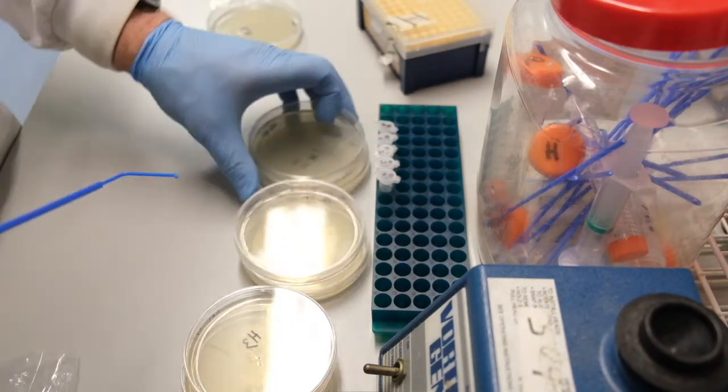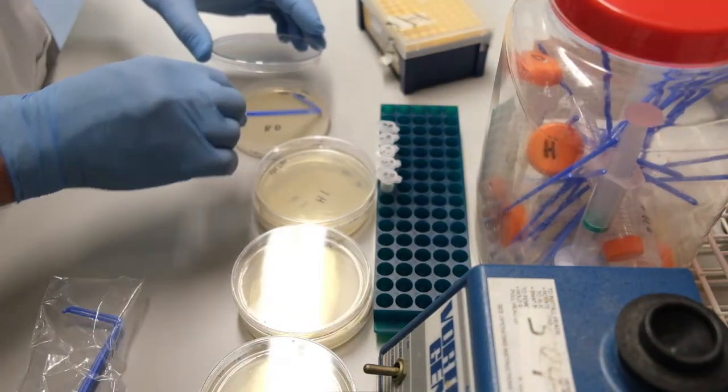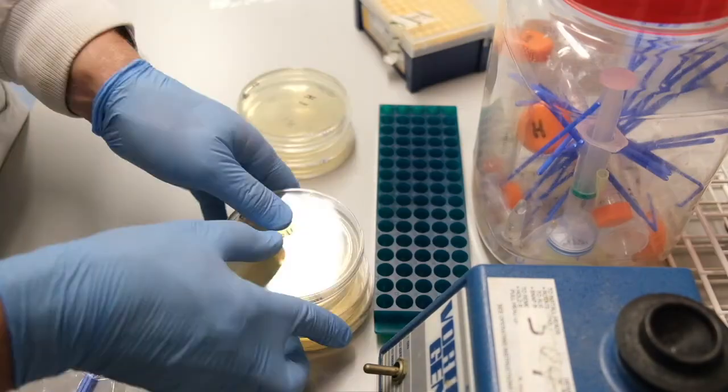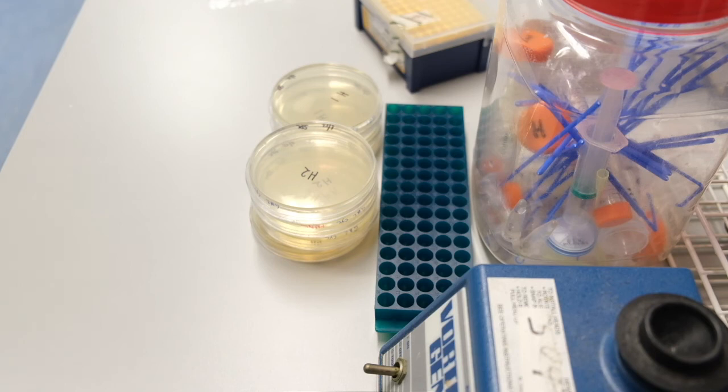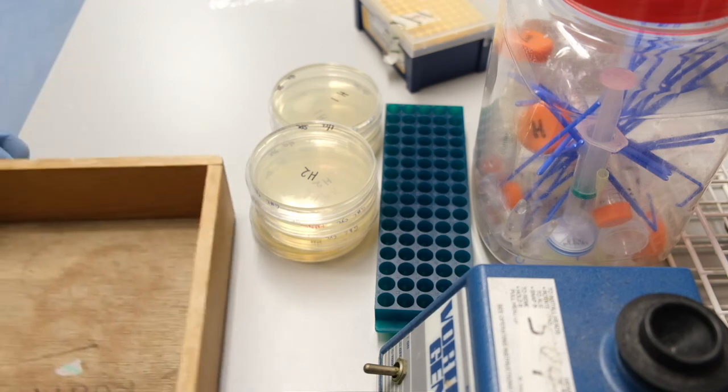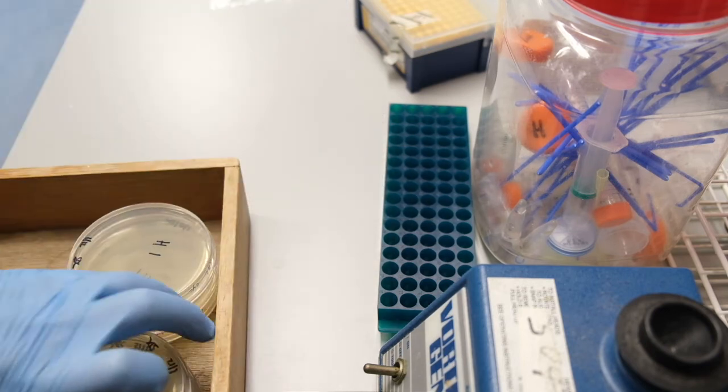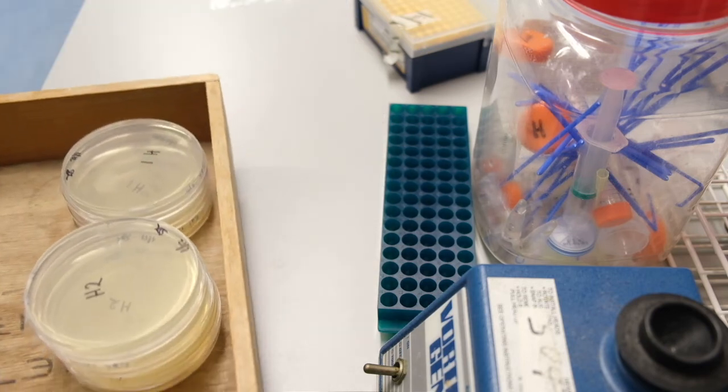All spreaders and other contaminated plasticware is disposed of in this plastic container with a lid. It will be sterilized by autoclaving.